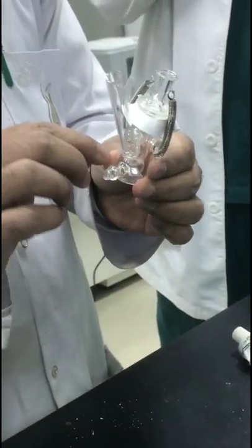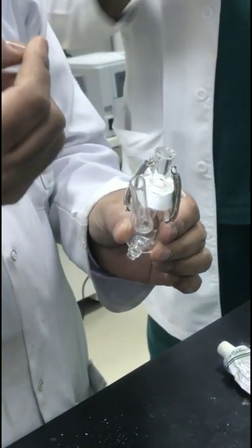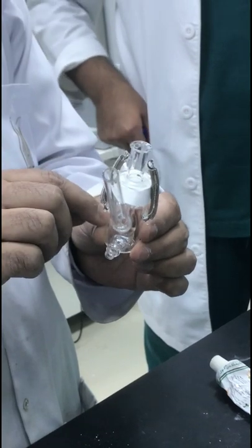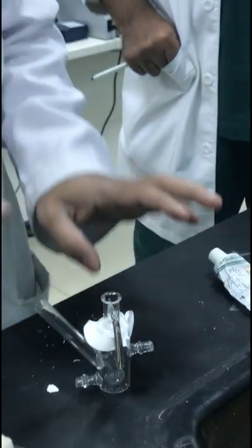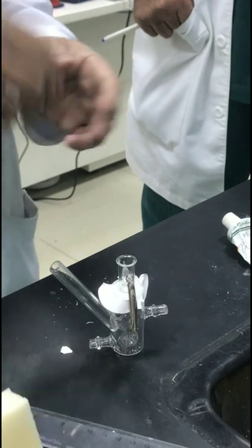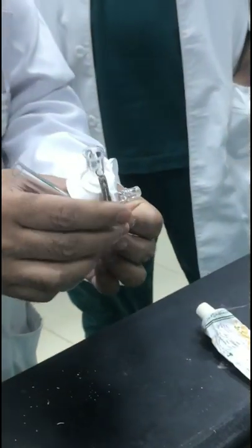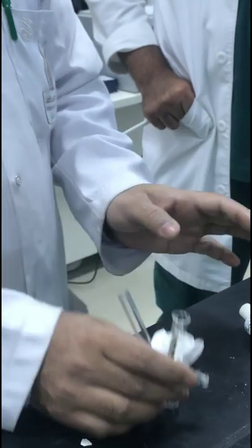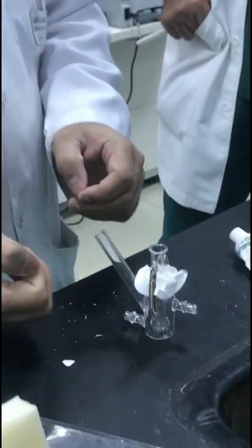After loading the drug, place the assembly on a shaker. Ideally, a very small magnetic stirrer is placed inside the receiver cell and the whole assembly is put on a magnetic stirrer to revolve. If that is not available, place the assembly in a shaking bath, let it revolve slowly, then stop the machine to take a sample.